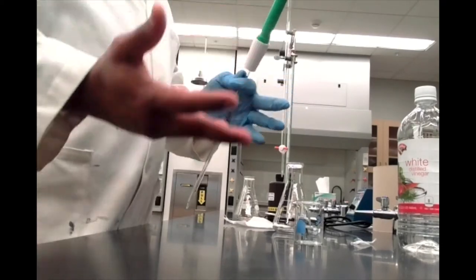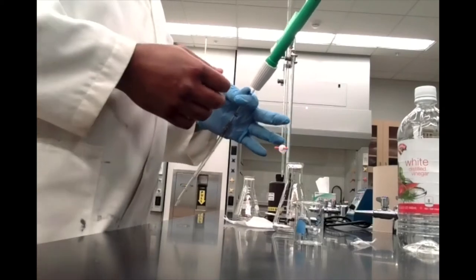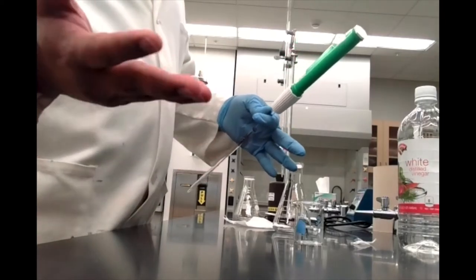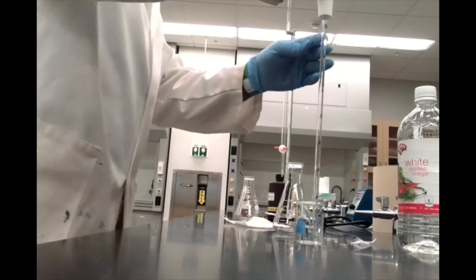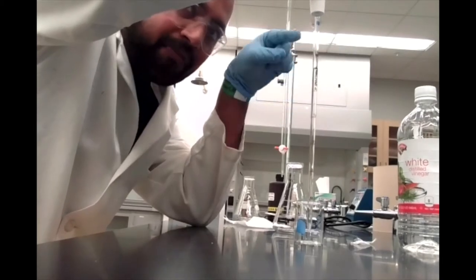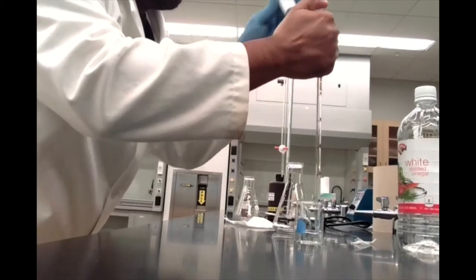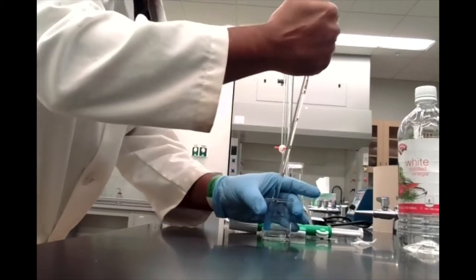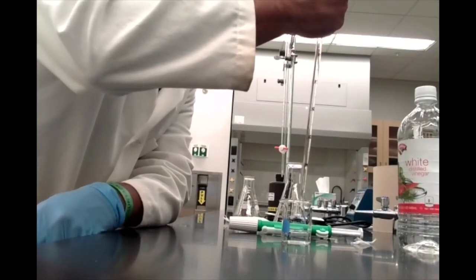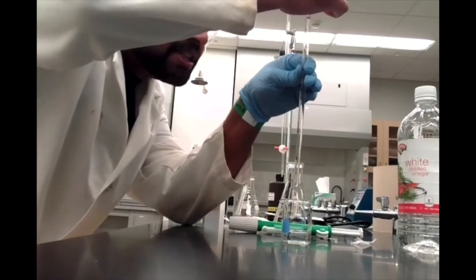Generally you want to wear gloves in lab, but in this case we're not dealing with anything too harsh — our sodium hydroxide isn't a super high concentration, so if I get anything on my hands I can wash it off. So let's draw up vinegar into the pipette past the volume mark, being careful not to get it into the pipette bulb. Then I use my thumb to gradually release the hold on the opening of the pipette, slowly releasing vinegar to get the volume marking to the zero point.